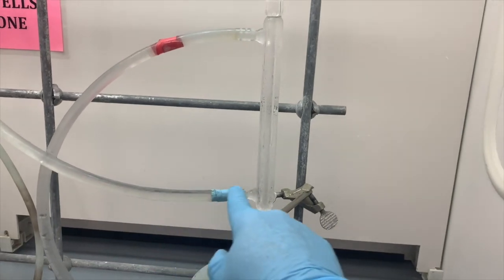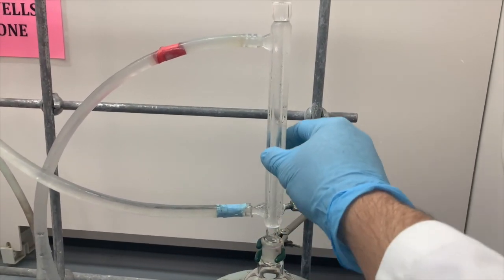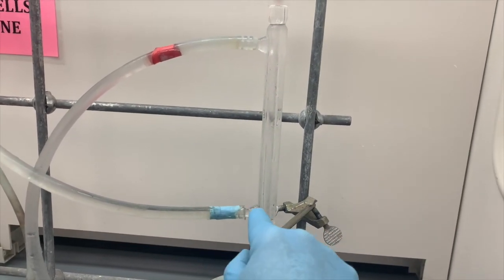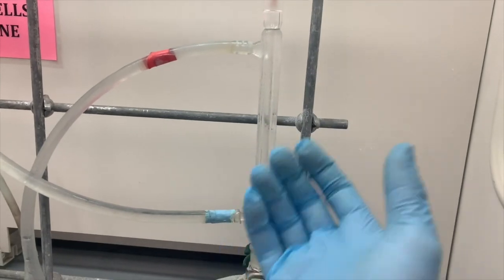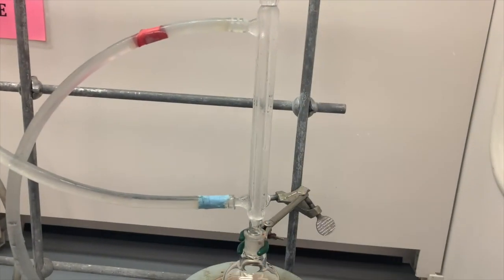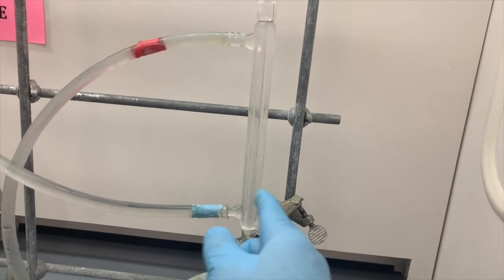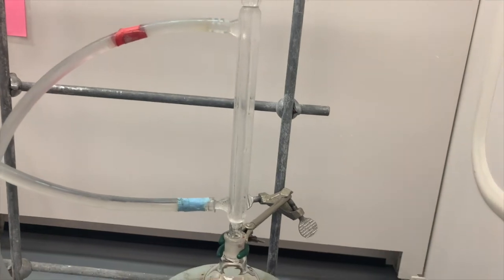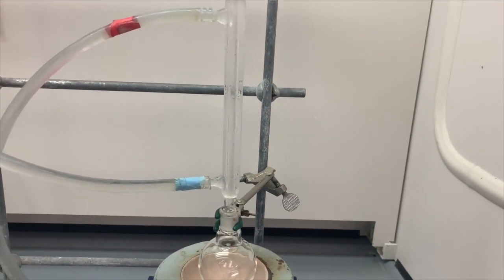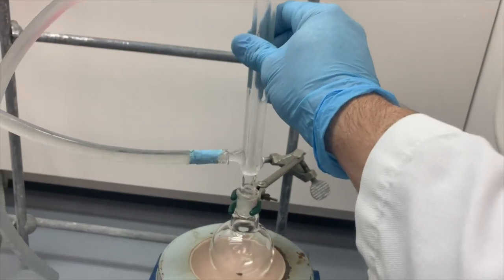It's because if you fill from the bottom and go out the top, you fill this entire jacket with water and maximize the surface area for the internal tube to be cooled by that cold water. If you just flow from the top, you're just going to have this waterfall, and the water is going to come out of the bottom, and then the jacket's only going to be partially filled. Filling from the bottom allows for full filling of cold water in that condenser. But we don't want to have that on there yet.